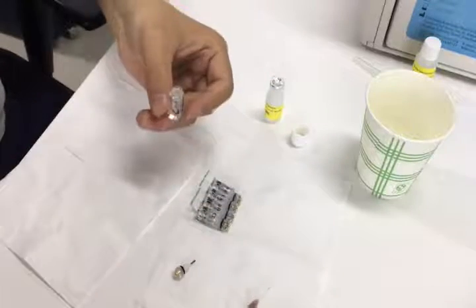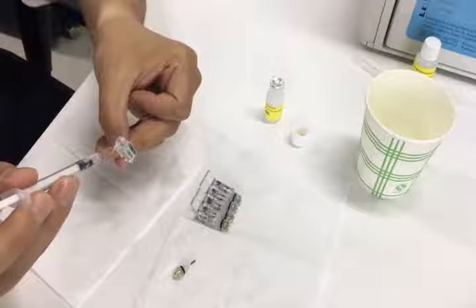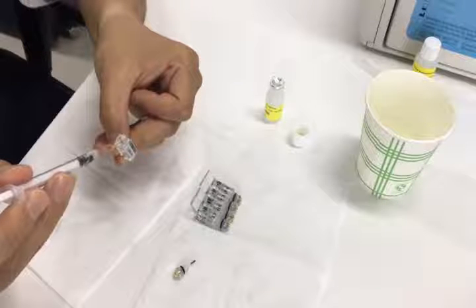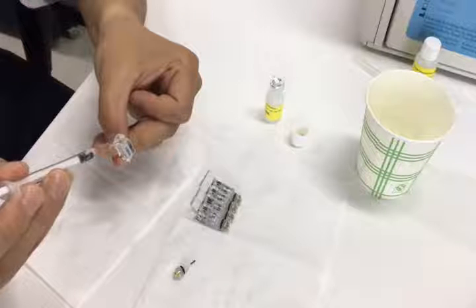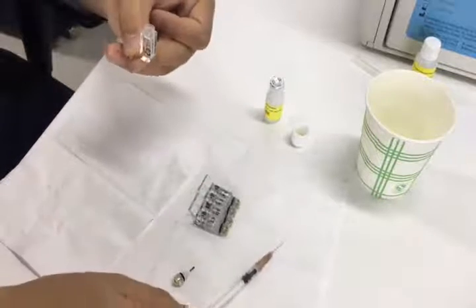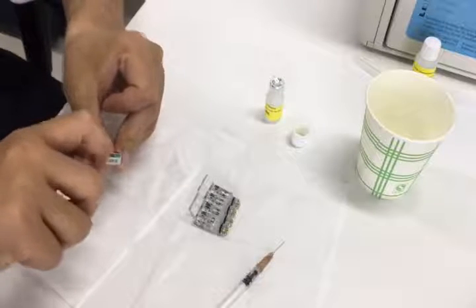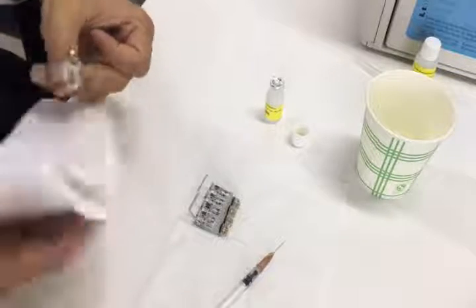Then remove it out. Then we put the rest into it. Tilt the needle to avoid damaging the membrane — we need to push the syringe very slowly. Then close the cap. Use the tissue to clean it.